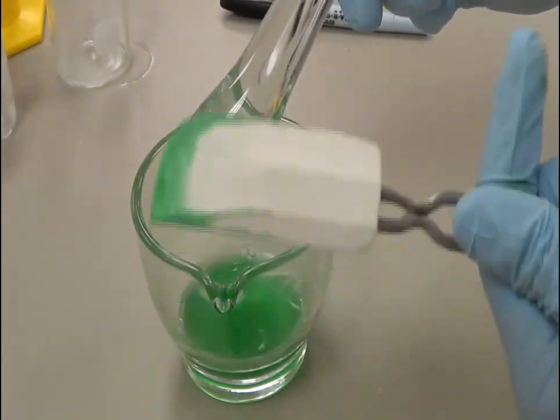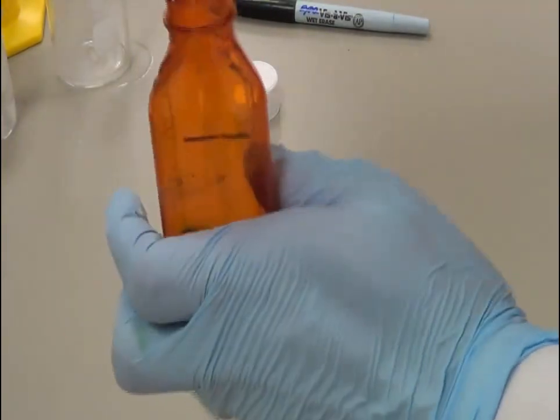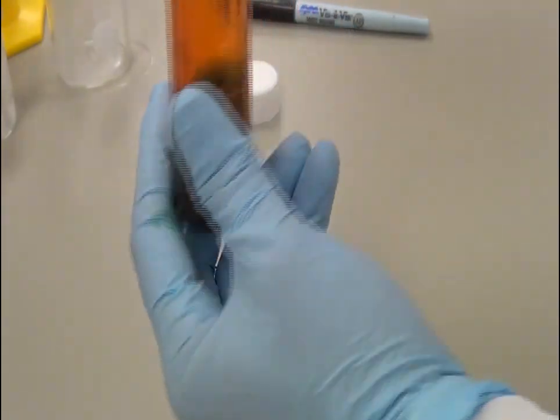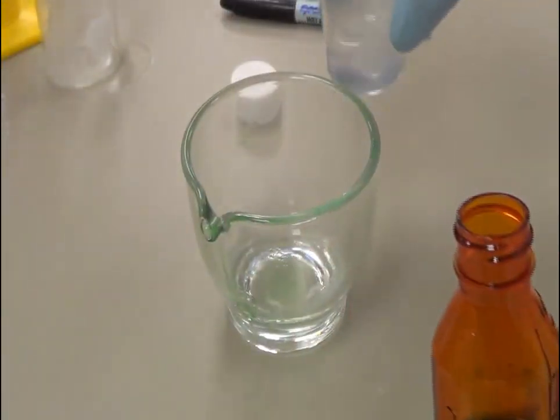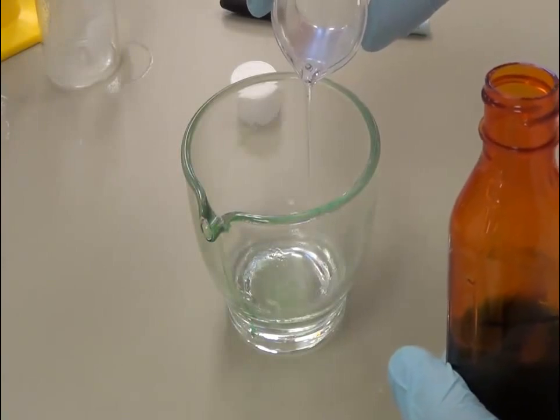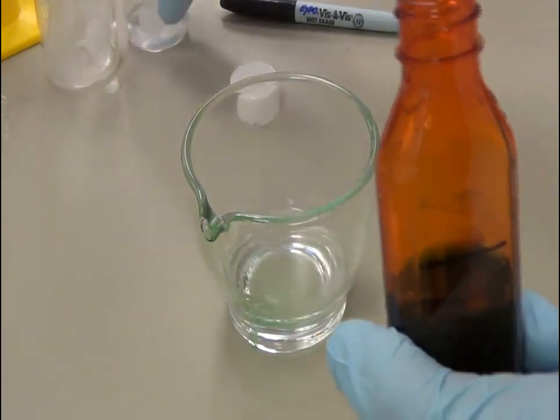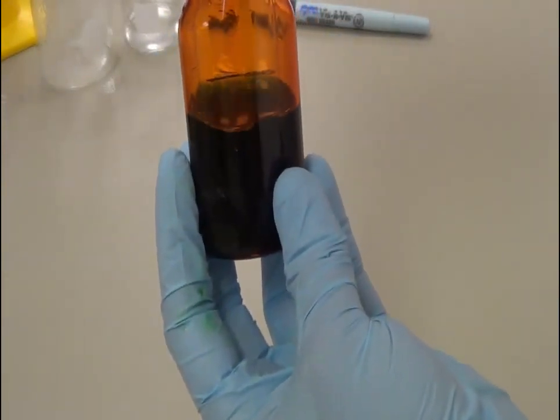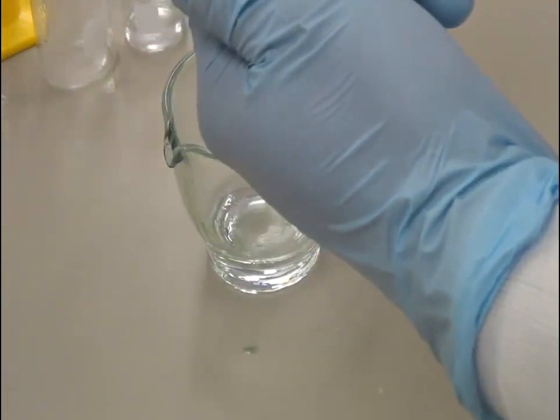The spatula still has some leftover drug, so I am going to pour that into the bottle. As you can see at the calibration mark, there is still some leftover, so I am going to pour some more. We have a total of 30 ml, so I am pouring all the 1% methyl cellulose solution back into the bottle.